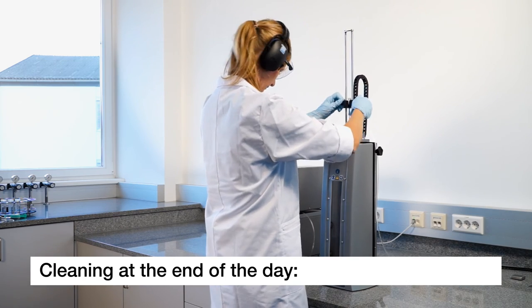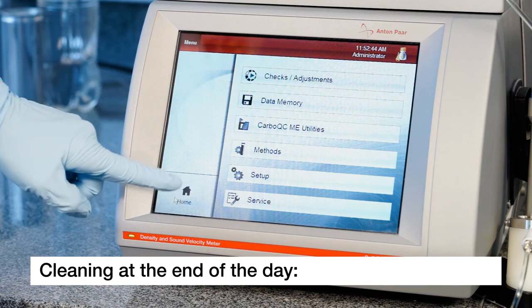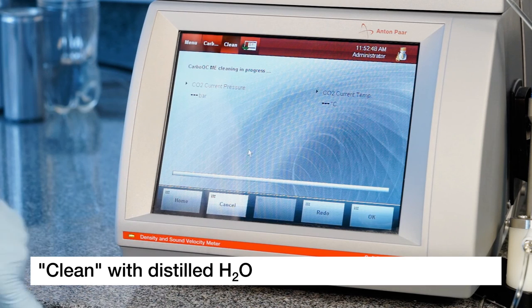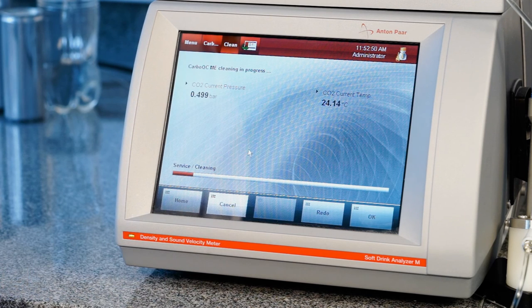For daily cleaning, insert a bottle of distilled CO2-free water instead of your sample. Select Clean to start the automatic process. After about 2 or 3 minutes, stop the process again.